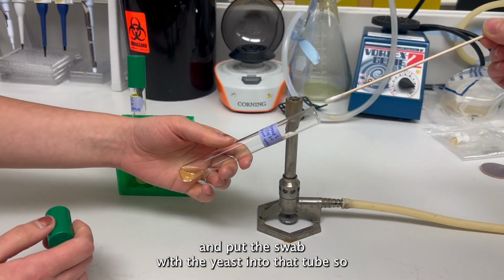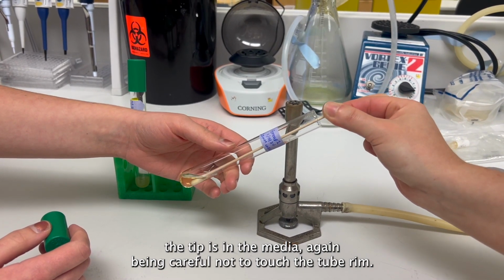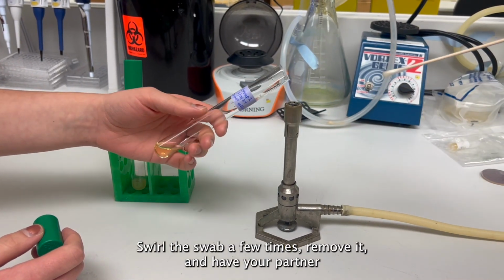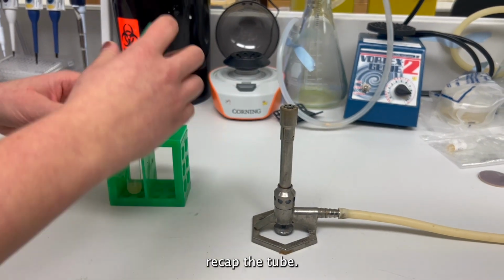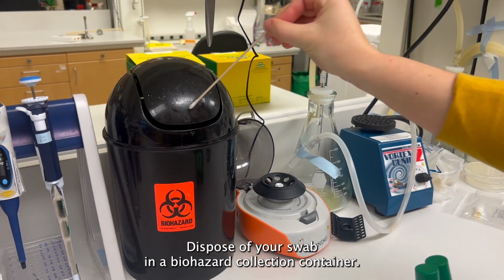Then have your lab partner uncap the tube for your new culture and put the swab with the yeast into that tube so the tip is in the media, again being careful not to touch the tube rim. Swirl the swab a few times, remove it, and have your partner recap the tube. Dispose of your swab in a biohazard collection container.